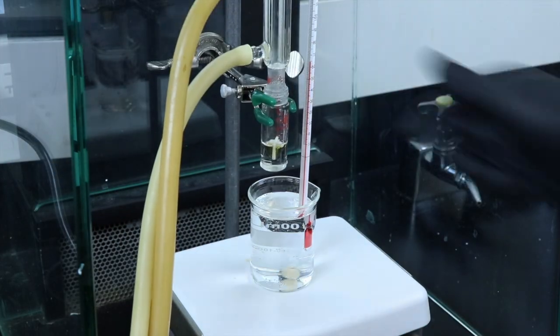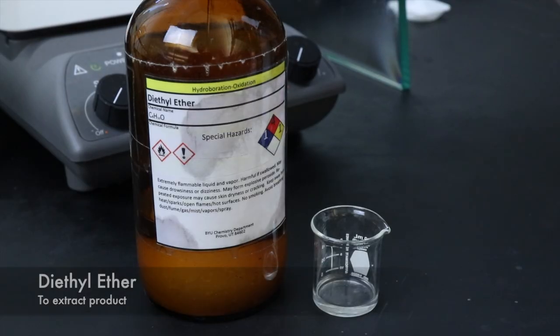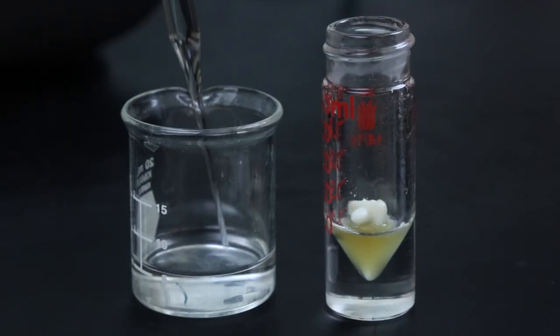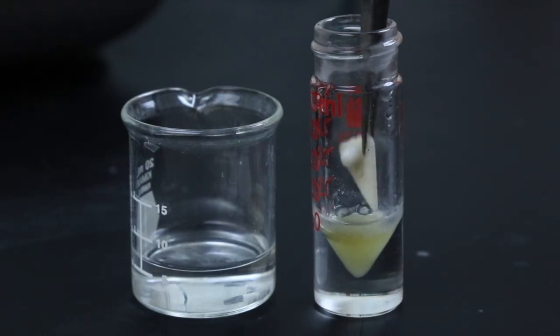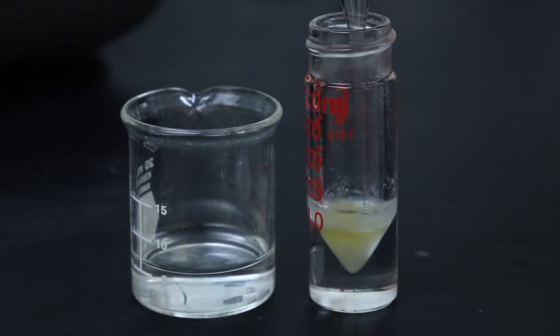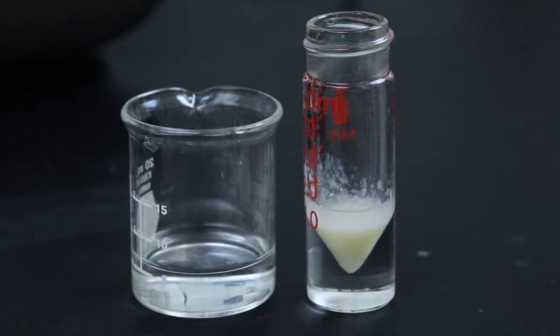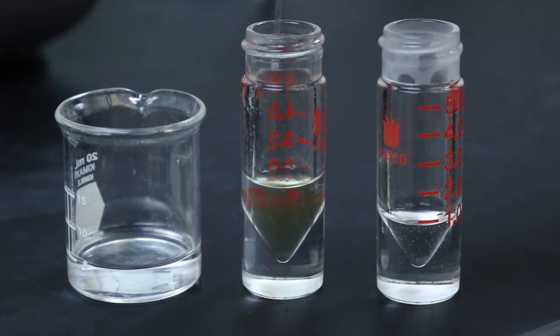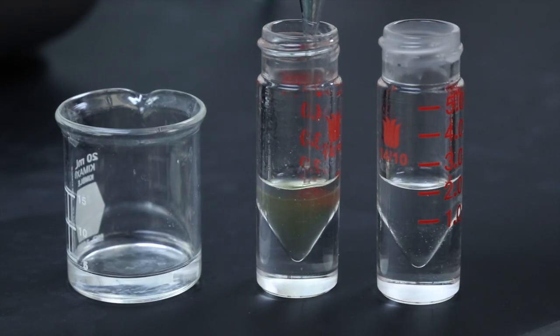Once the hour has passed, I'll remove the conical vial from the hot water bath, and start getting some diethyl ether to begin the extractions. It's difficult to see the product ether layer, so I'm going to add some initially just so we can see it better, and remove the spin vane, rinsing it with some ether as well. Then I'll mix the phases together really well, and I'm actually going to add a little bit of distilled water to dissolve the remaining slurry, and so we can see the phases better. Now I can remove the ether layer, and continue to extract the aqueous one three more times with diethyl ether.